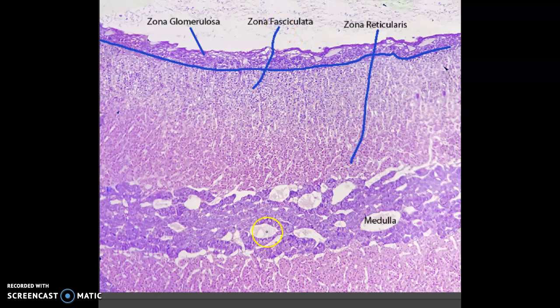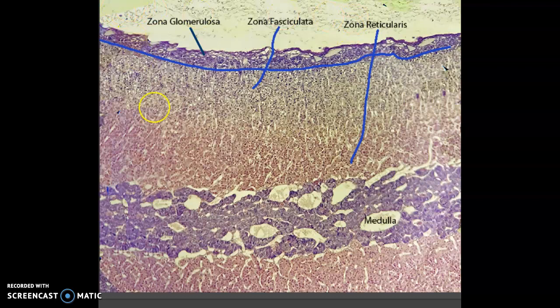Now the center here is the adrenal medulla. I actually like this slide so much better than our older slide because the medulla is very distinct from the reticularis. Now, what I'm going to do is I'm going to go to Autotone. I'm going to select the layer I want and then go to Autotone. See how it comes out differently now? And you could see where I photoshopped out her blue, so she had black there.